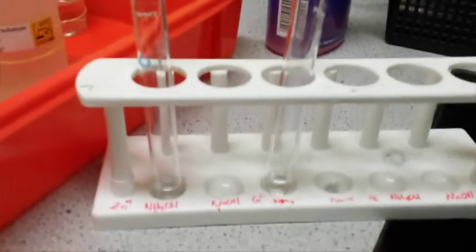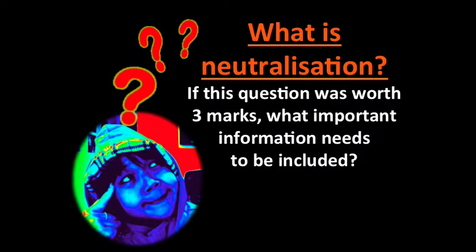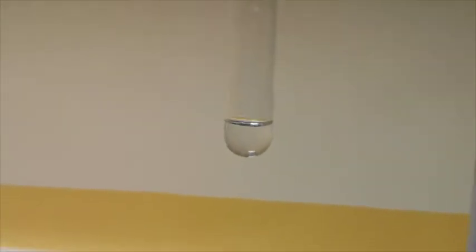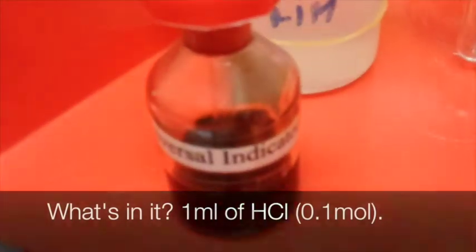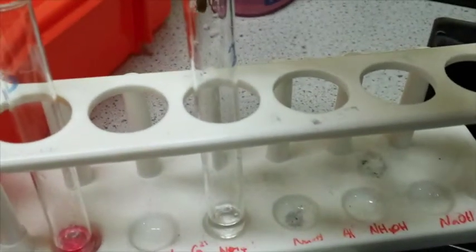What I'm showing you right here is our neutralization experiment. As you can see, I labeled the test tube 0.1 and 1, and in it we have already 1 milliliter of hydrochloric acid. So the next step that you were supposed to do was to take some universal indicator and put about 1 drop each. Okay, so there's 1 and 1.